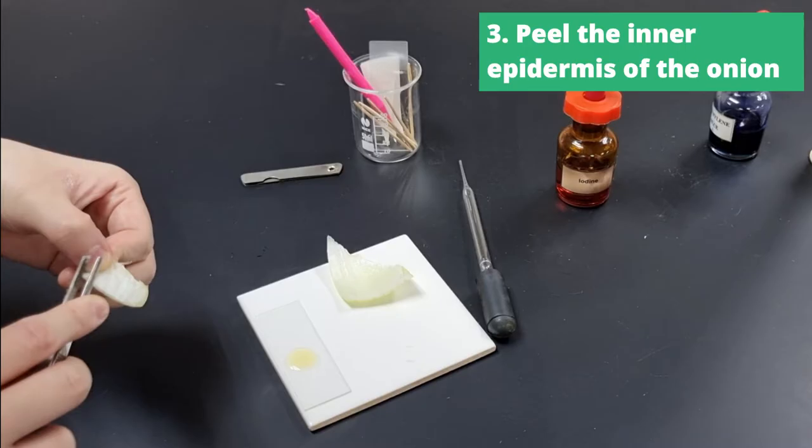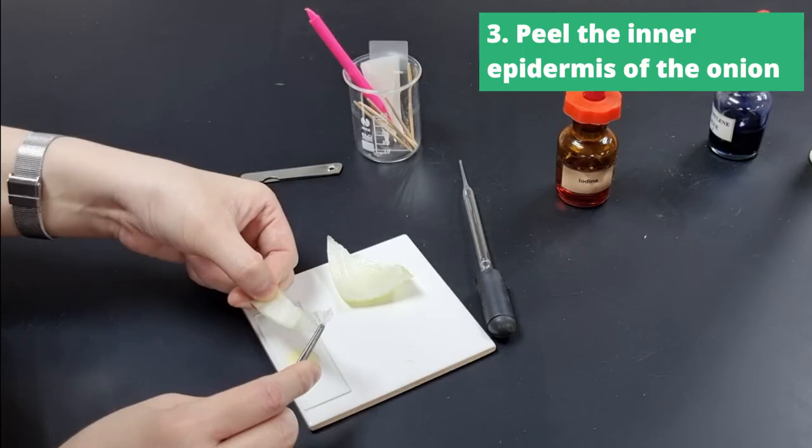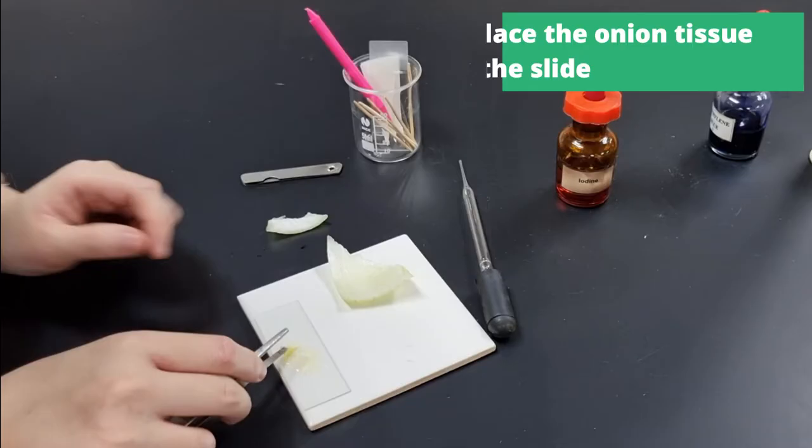So this is me trying again after failing once. Gently peeling it from the side will help it come up, and as you can see here it's very translucent, very fragile, a tiny piece.